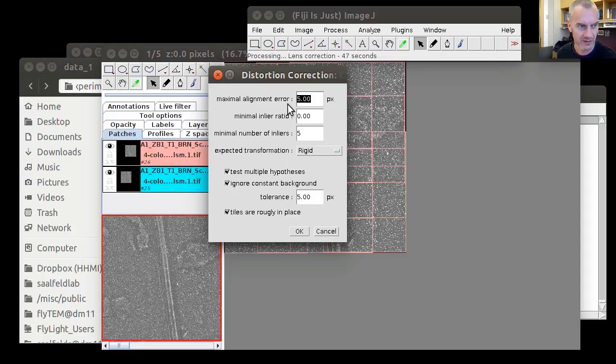So for now, we set the number of correspondences that we want to see in these sets to 5, the minimum number. And we're expecting at least a rigid transform, so images can shift and rotate relative to each other, which is probably a good approximation of what can happen at the periphery of individual tiles. We test multiple of these hypotheses and we want to see them all. We ignore constant background. In this case, it is again not very important. And we know that the tiles are roughly in place, so we don't have to compare this tile with that one because they don't overlap.